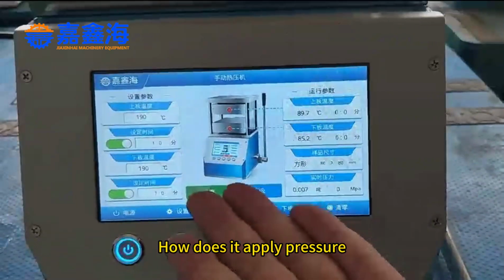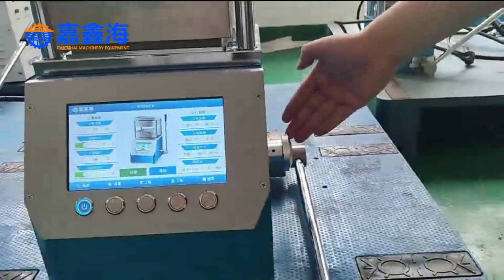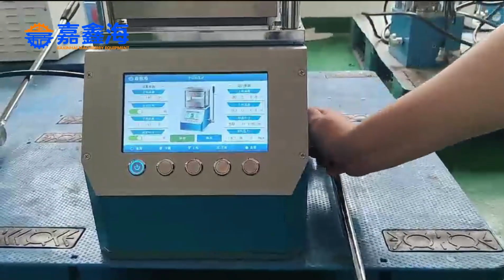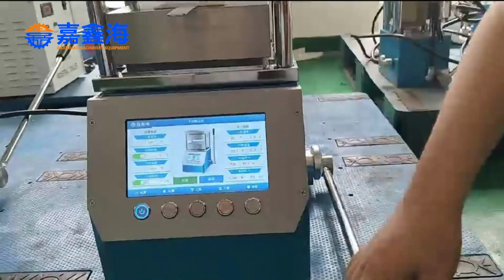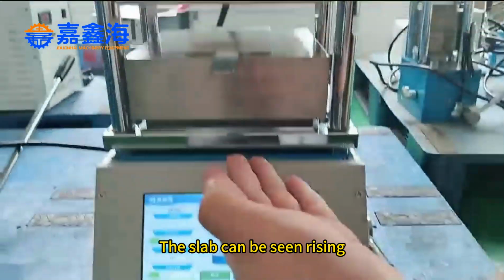How does it apply pressure? There is a valve on the right side. Tighten it. Pressurization can be carried out immediately. Shake the pressure rod. The slab can be seen rising.